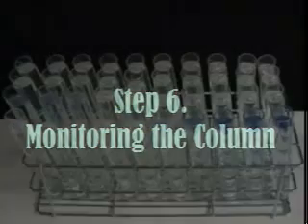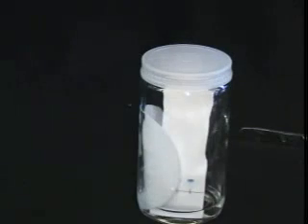Now your hard work is over and it's time to see if it paid off. When your compound is colored, it can be easy to find it in the fractions. But a more reliable method for monitoring your column is with TLC. You can easily spot five or six fractions per TLC plate. Make sure you rinse your spotter in between fractions. Develop the plates with a solvent mixture that spreads the spots out on the plate. It does not have to be the same solvent system you use for the column.